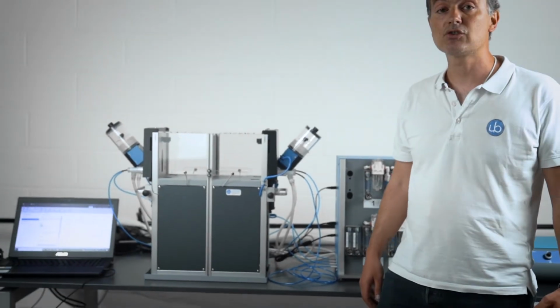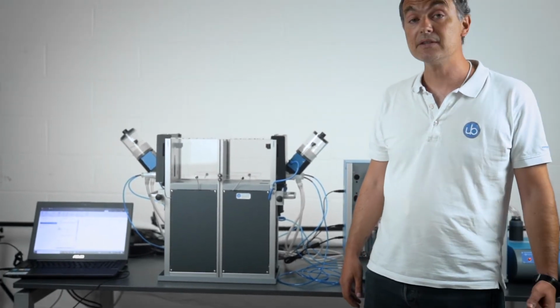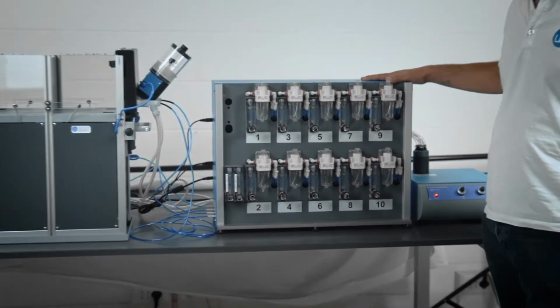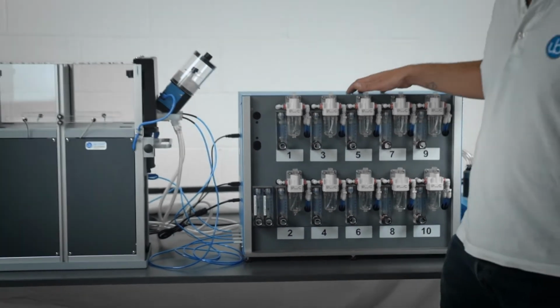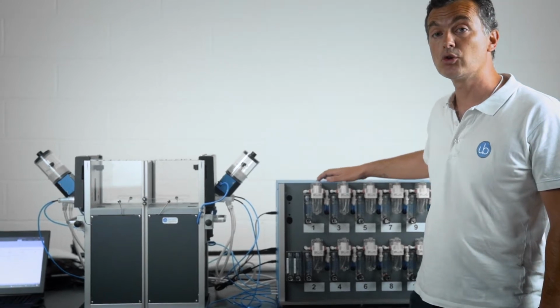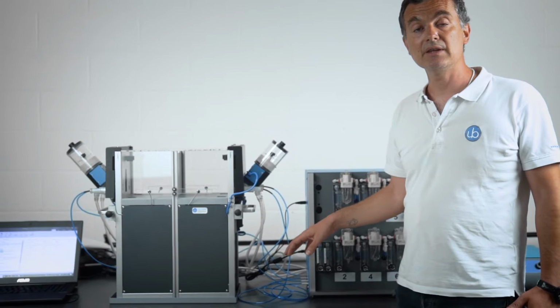And these 3 dimensions are tactile dimensions, lights, and odors, as you can see from this 10-channel odor air delivery. So we will now go through the different components of the system and then show you how they are all controlled through the Animaze software.